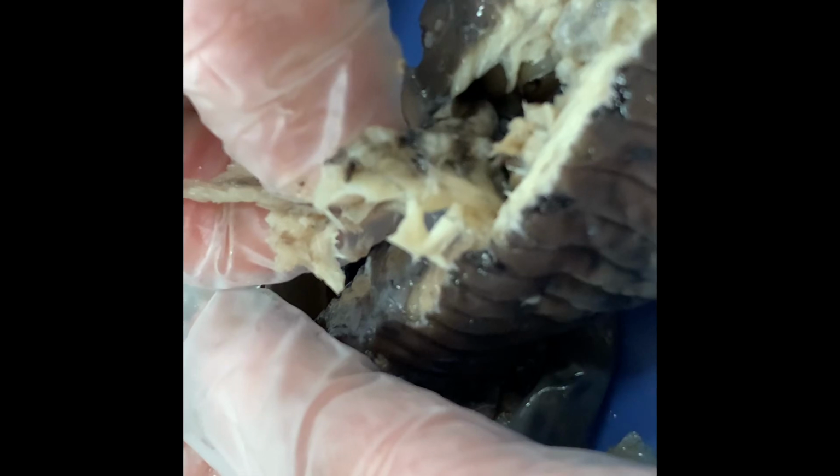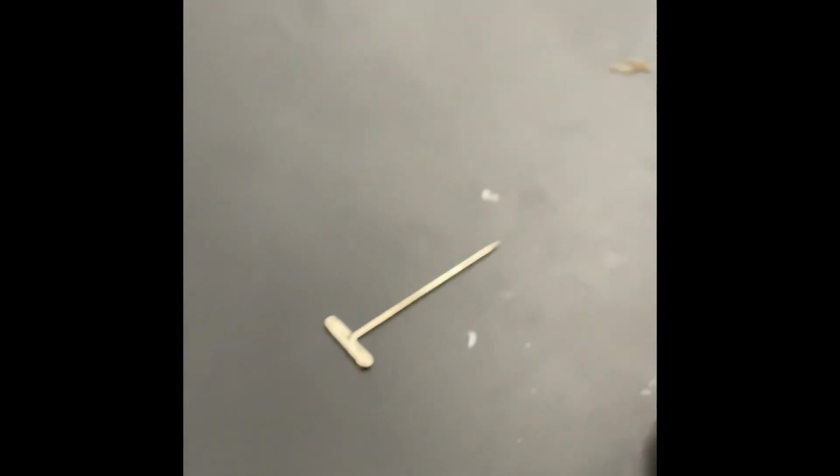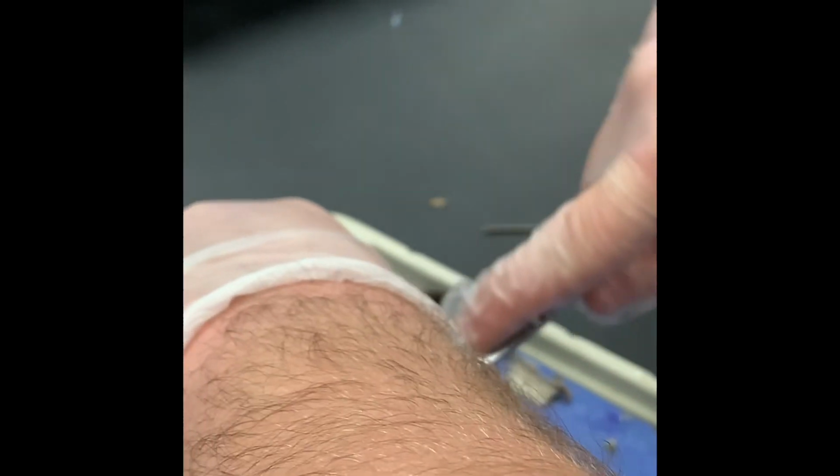Nathan, did you check for an organ donor card? Oh yeah, he had one. Alright. She. I keep on saying he. Very much a girl. Sorry, Sally. Tyler didn't have any organ donor cards. We're gonna throw all of his organs away. I thought I'd take one of them, but he didn't have an organ donor card.